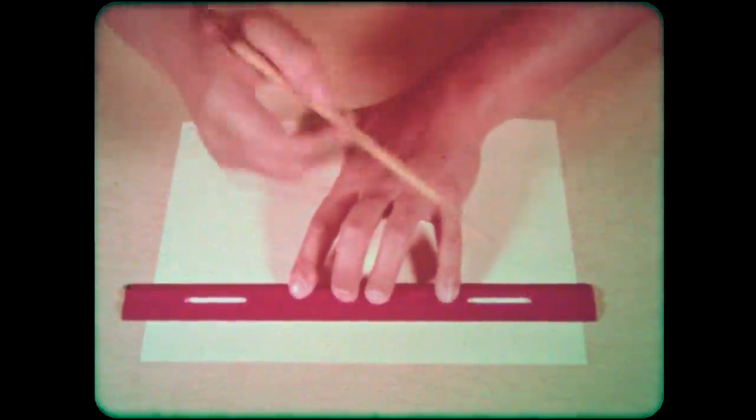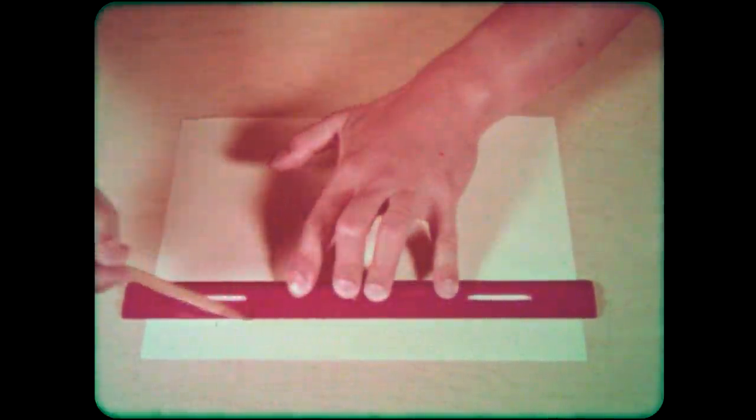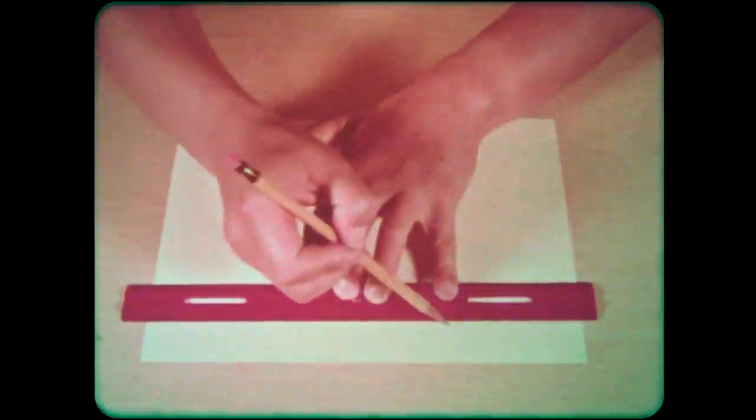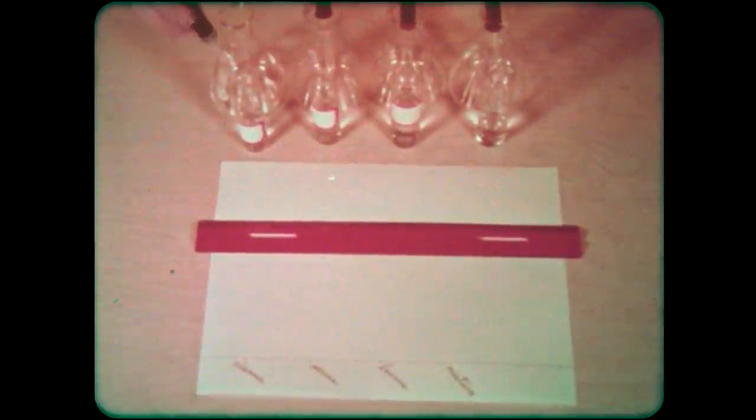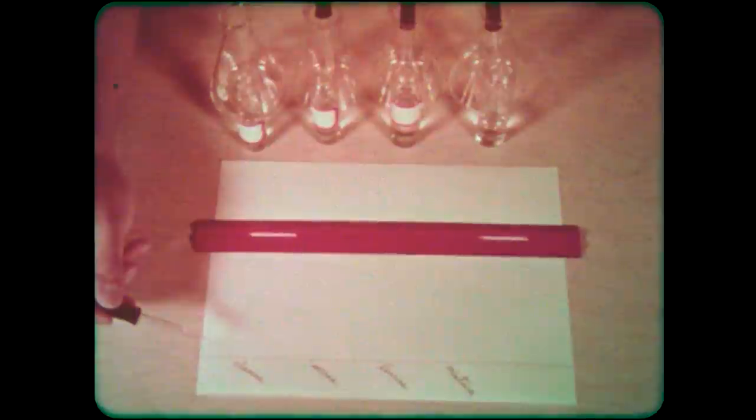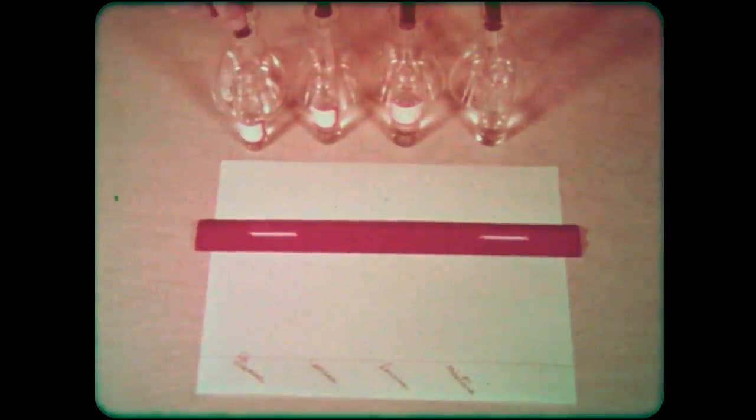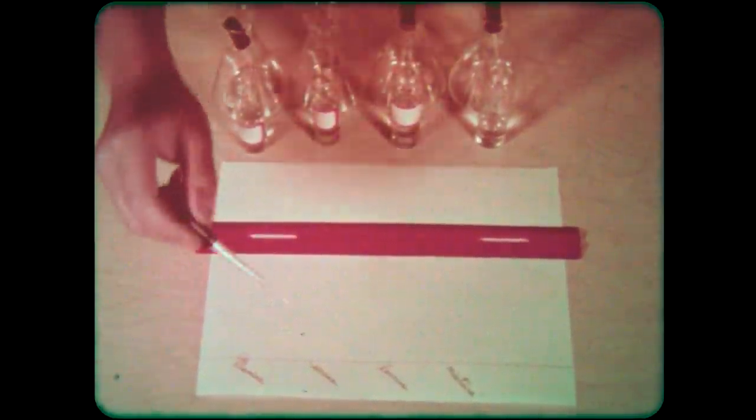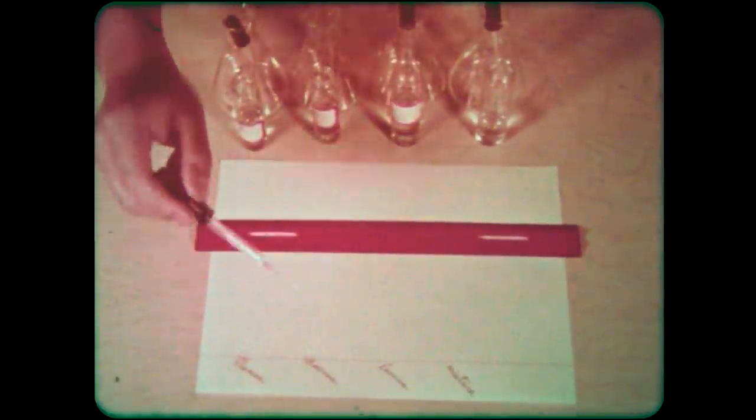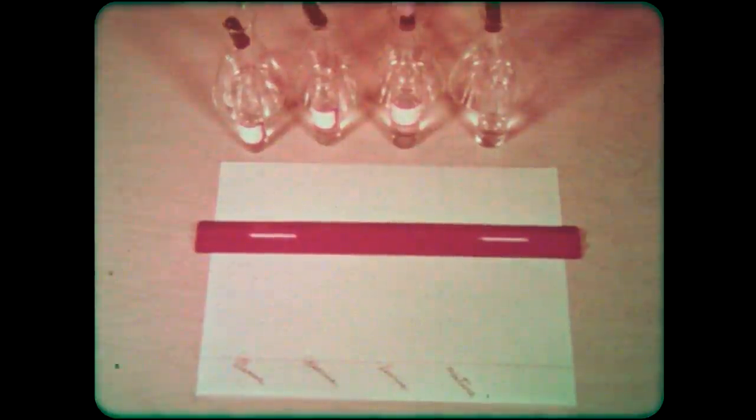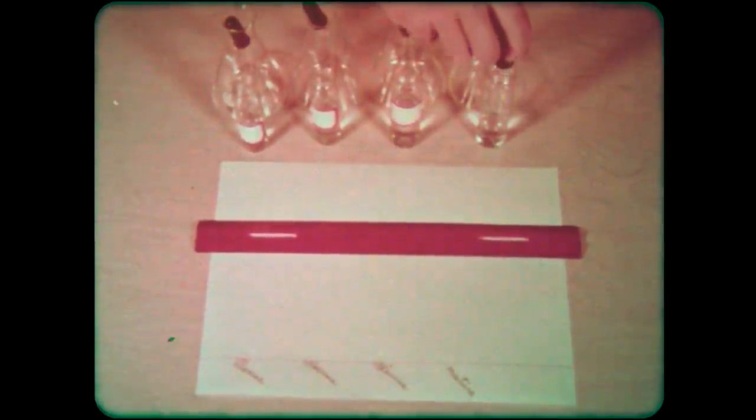Replacing the cover produces a saturated atmosphere. A flat sheet of filter paper is carefully marked and labeled. Micro pipettes are used to spot small amounts of three separate amino acids: alanine, serine, and leucine. On the fourth mark, a mixture of all three is spotted.